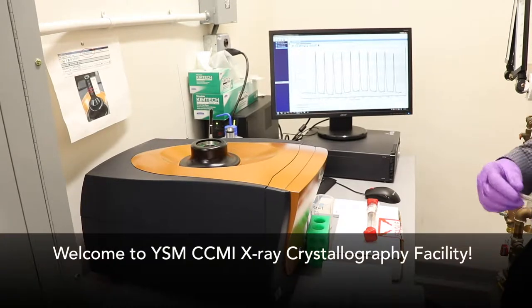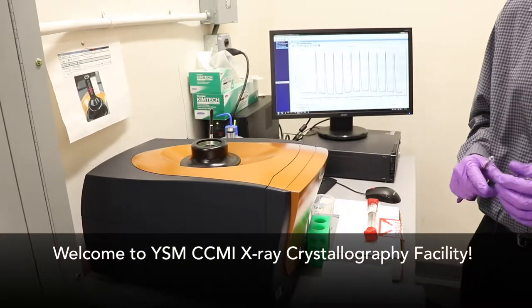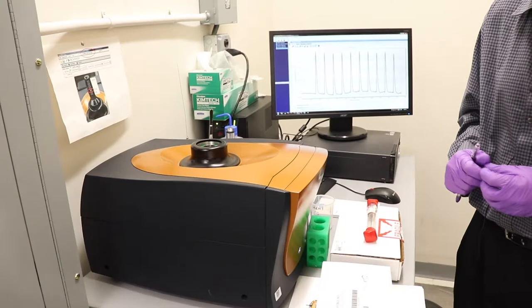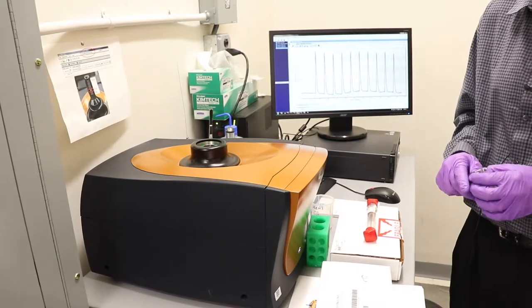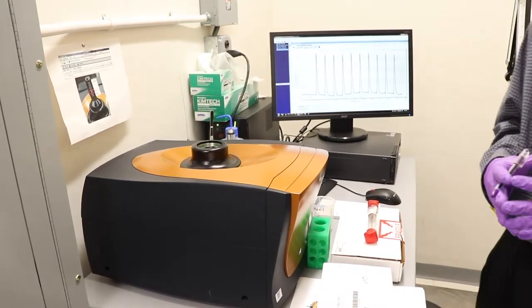Hi, welcome to another training video for the Yale School of Medicine CCMI x-ray core facility. Today we're going to be learning how to use our nano ITC which is by TA Instruments.